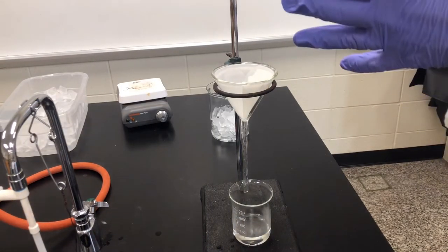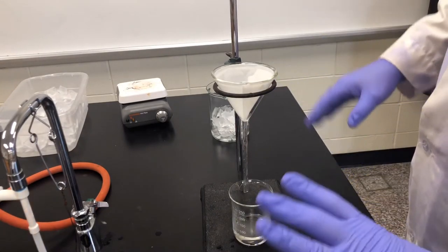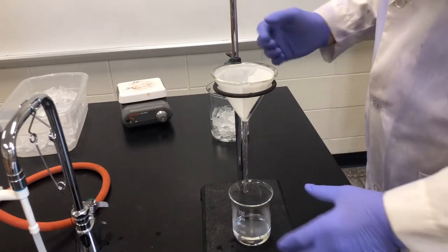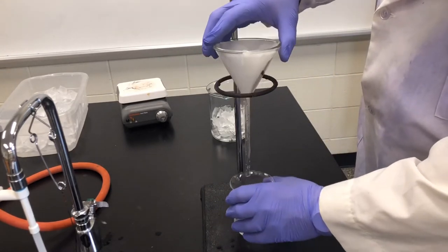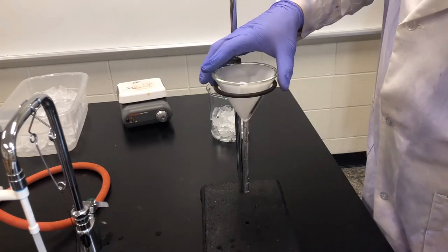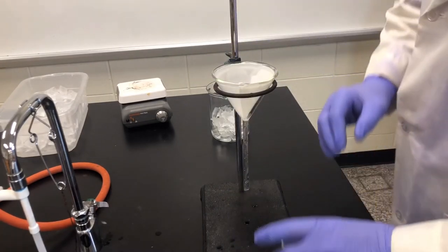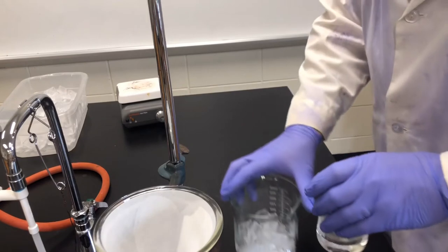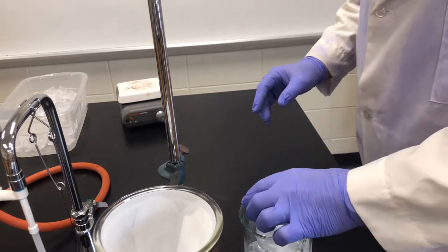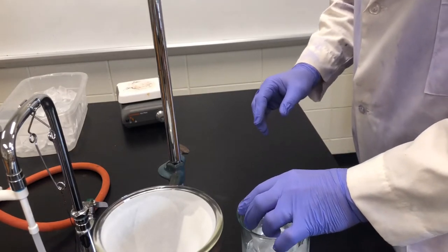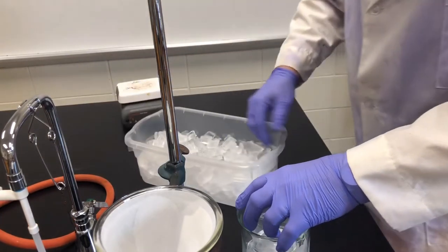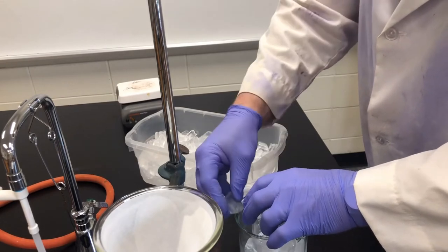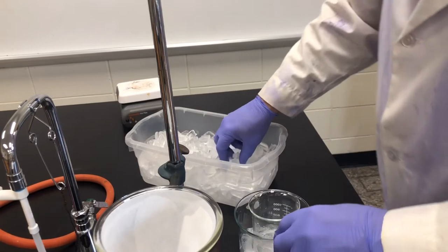As this is filtering, someone else, your lab partner, is getting this stuff ready. We need to get this into the ice bath and so someone would be getting that ready to use.